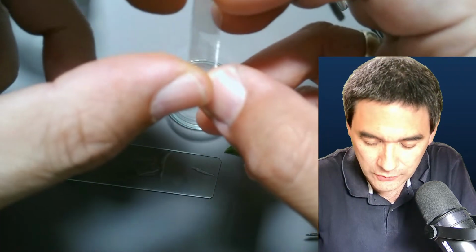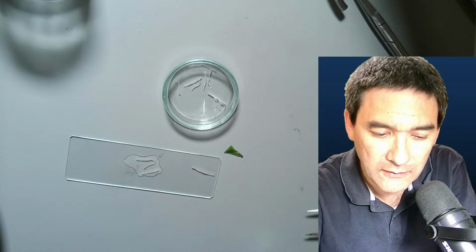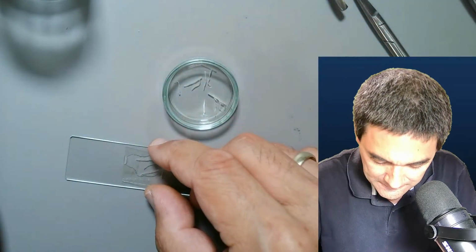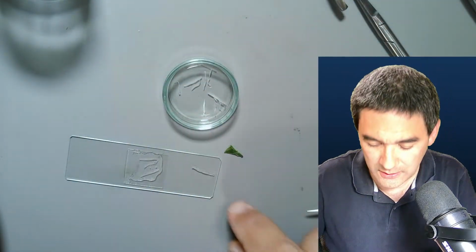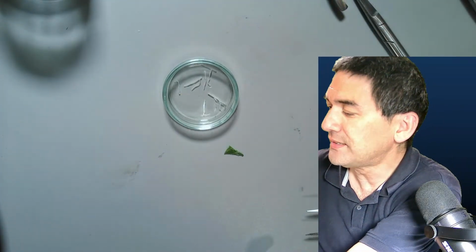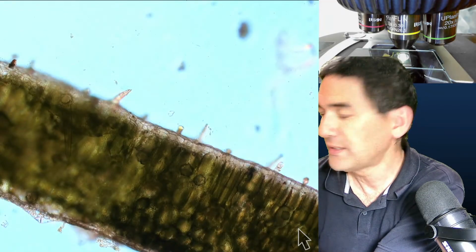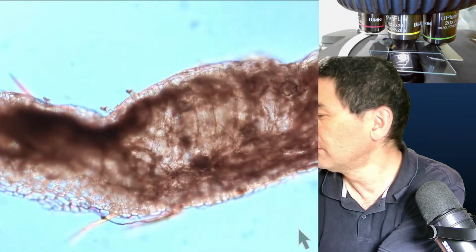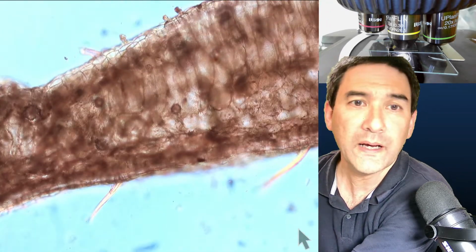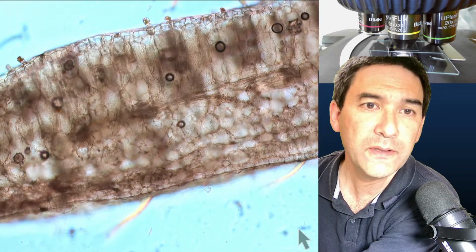I always have to check whether these are actually two cover glasses. Okay, let me try another one here. What did I have over here? Yeah, that's better. Okay, so let's have a look at this here now, simply to show you how a de-stained leaf looks. Here, that's the green one, the fresh one, and that's the one without the chlorophyll. And you can actually see that it is significantly brighter.